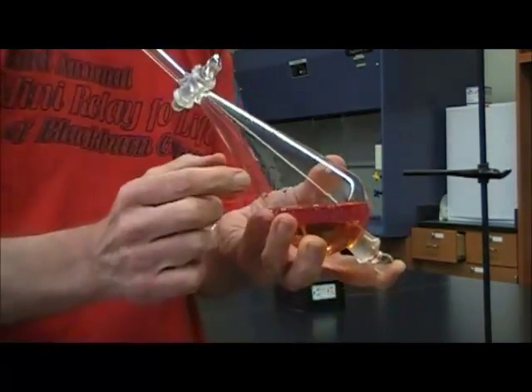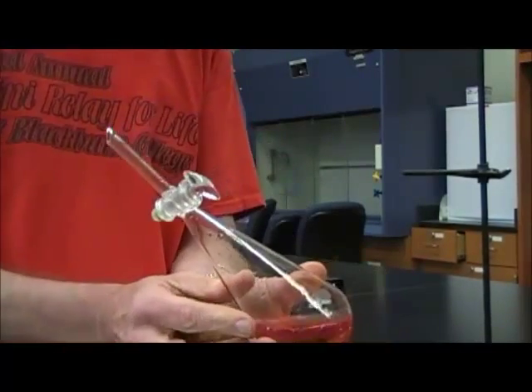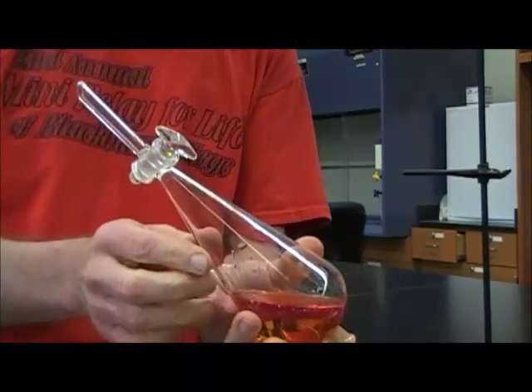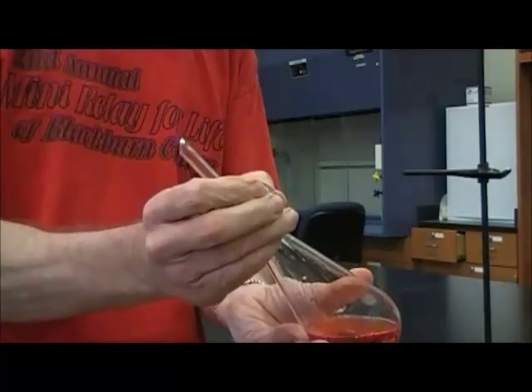I'm going to hold it upside down. Again, make sure the finger is on the stopper. I'm going to open the stopcock briefly just to let out a little bit of pressure. Notice that I'm aiming it away from myself, and also not towards anybody else in case a little droplet should fly out. You don't want it to land in anybody's eye.